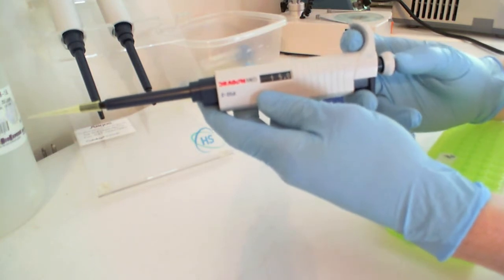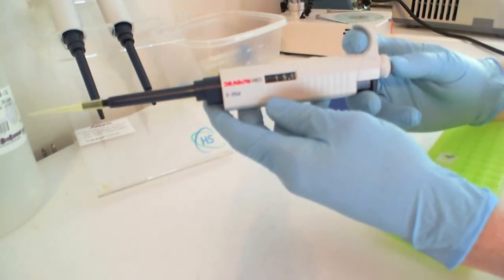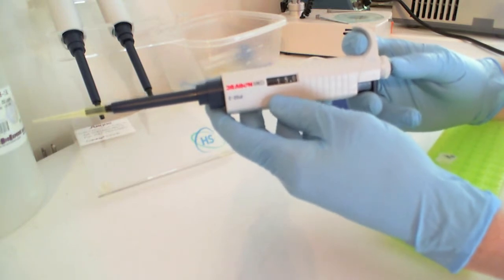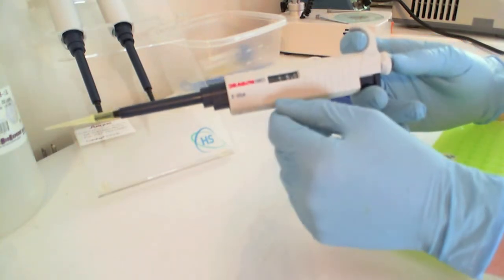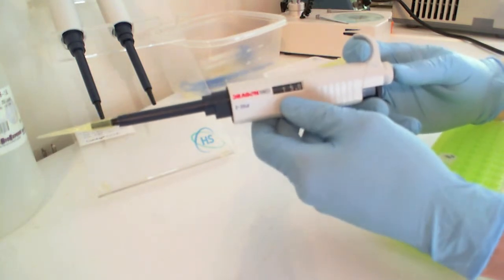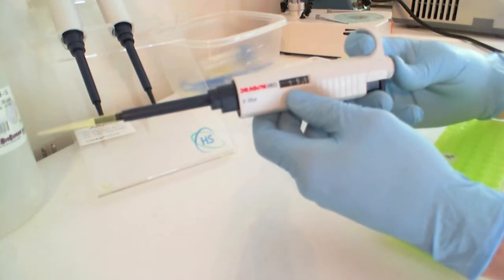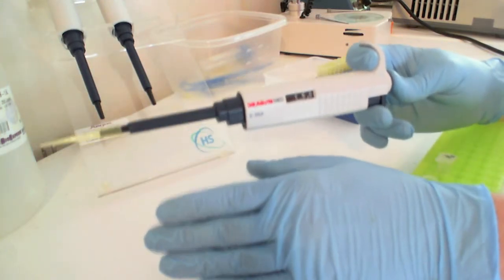By pressing the end of the pipette down to its first stop, you expel exactly the number of microliters written here on the side of the pipette. By pressing it to the second stop, you expel all of the liquid from the end of the tip.